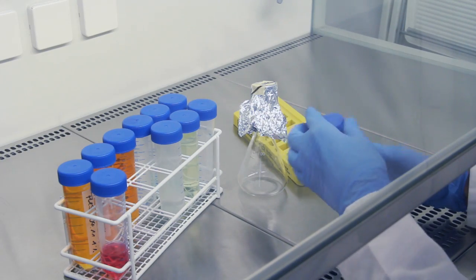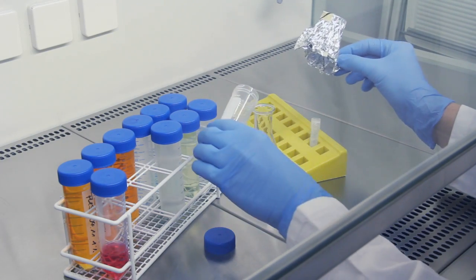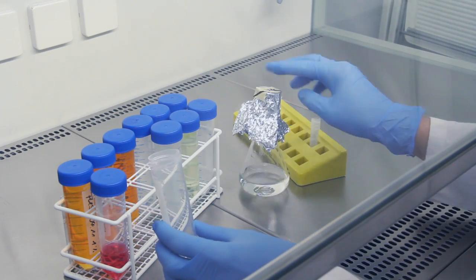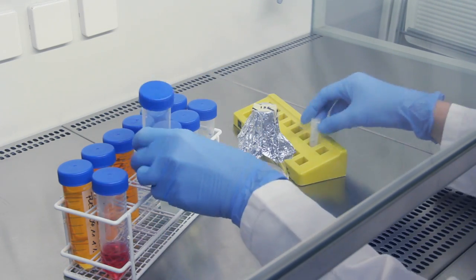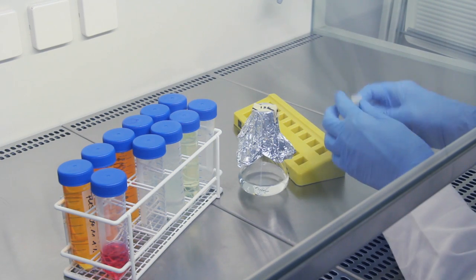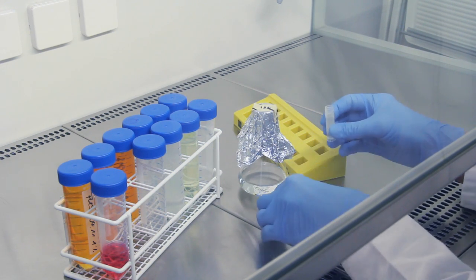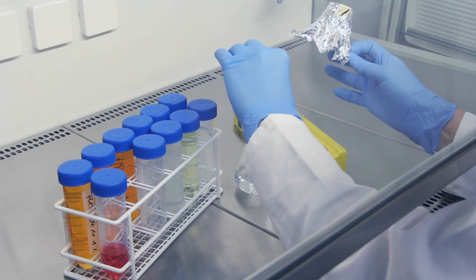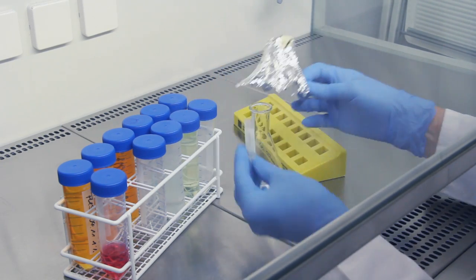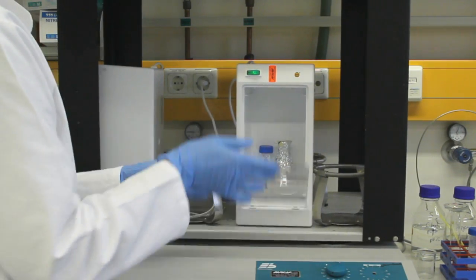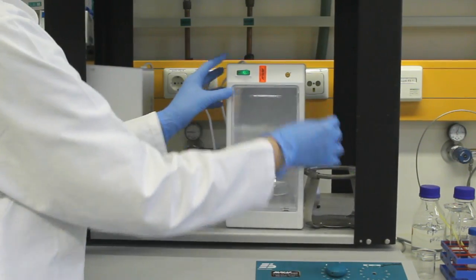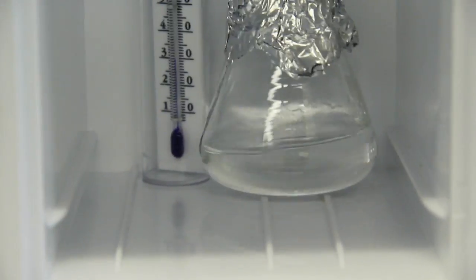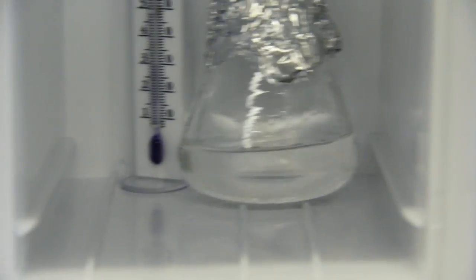30 ml of the sterile medium were filled into a sterile cultivation flask and inoculated with 1 ml yeast cell suspension. The latter had a concentration of 10^8 cells per 1 ml cryo medium supplemented with 30% glycerol and stored as cryo stock at minus 80 degrees until use. This inoculated culture medium was incubated at 30 degrees in an incubator positioned on a shaker at 100 rotations per minute for approximately 18 hours.